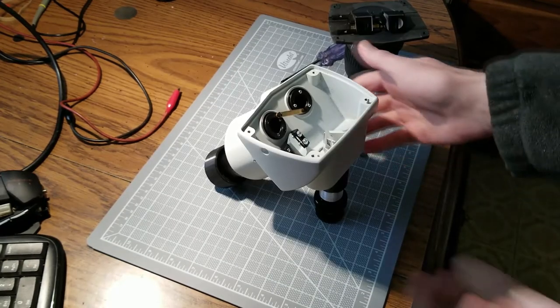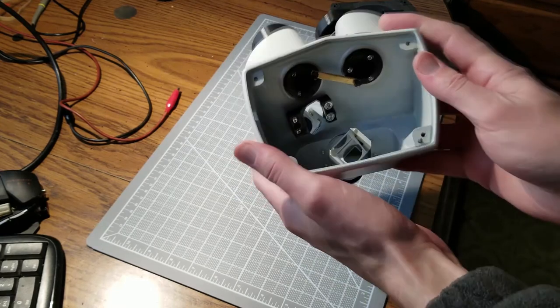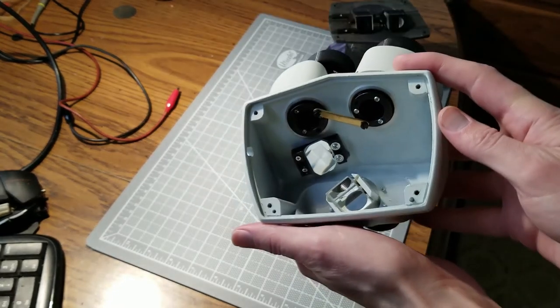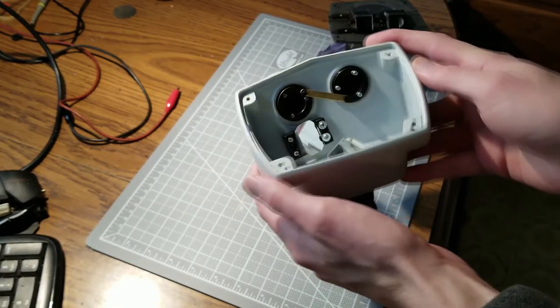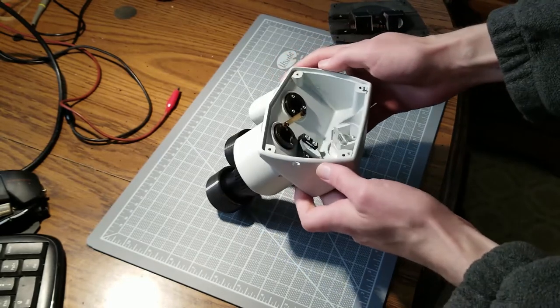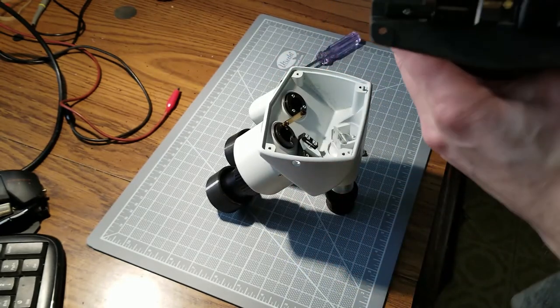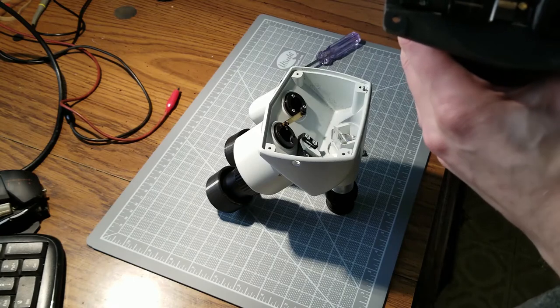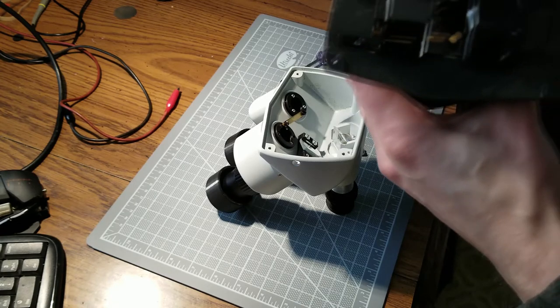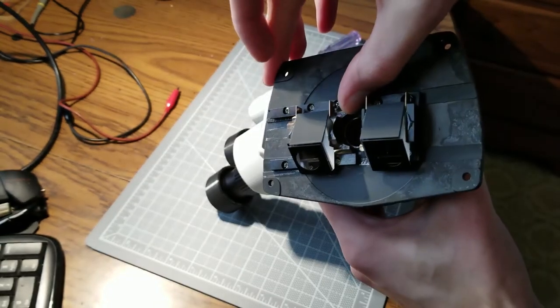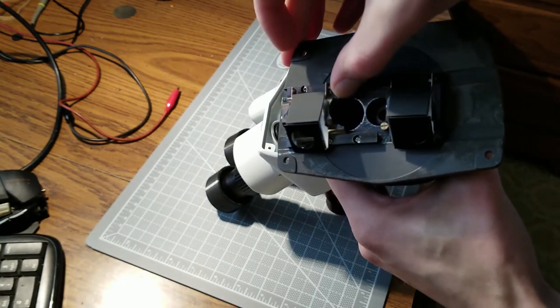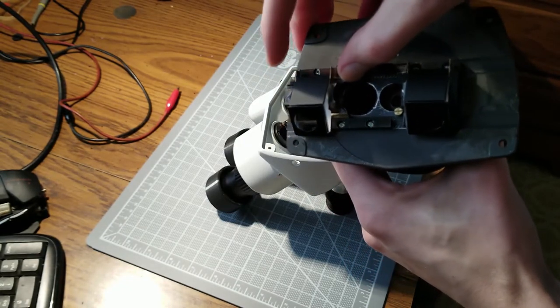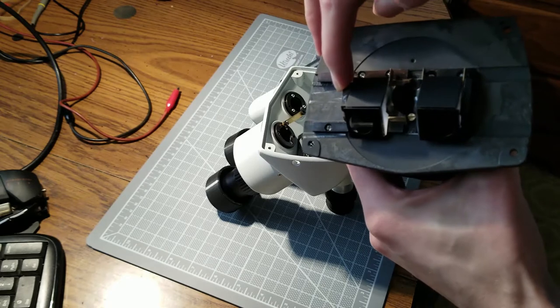Here's a little bit more detailed look inside. Not much to see, just some mirrors and some crystals that redirect light. So here you have the one crystal that's going to redirect light depending on which location it's in.